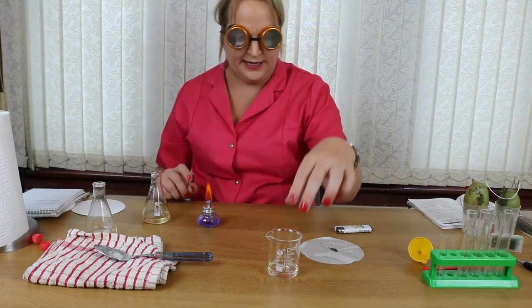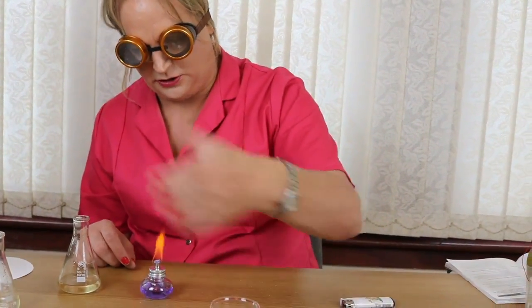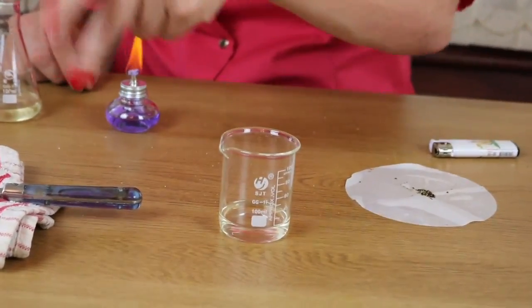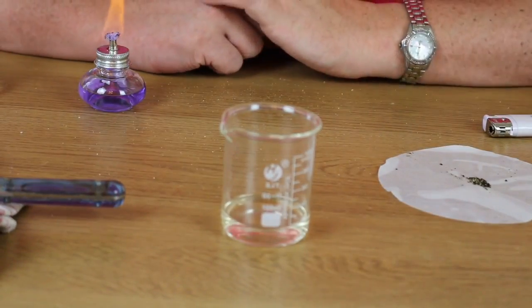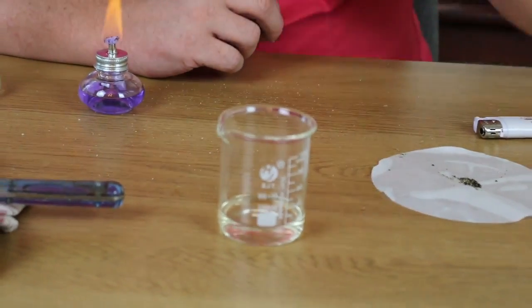And so there's that. And the last one is obviously crystallization. Now what happens is I'm just going to leave that for a few days or a week, and that water will evaporate off and there'll be the salt crystals in there. The difference between using the heat and not using the heat is the heat can sometimes damage the substance you get left with at the end. So the heat can sometimes destroy that. Otherwise you can just let it crystallize and let the water evaporate off.